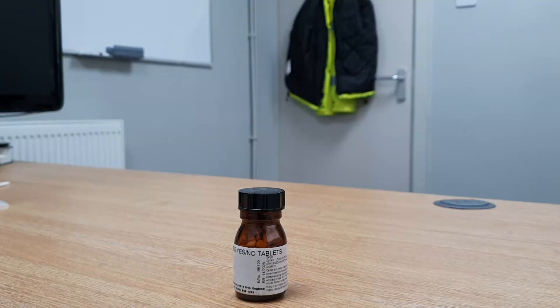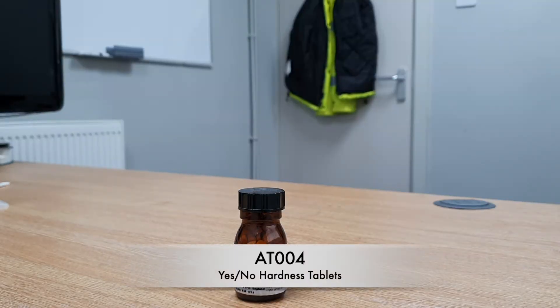For this test you will need the following reagent: Yes no hardness tablets AT004.